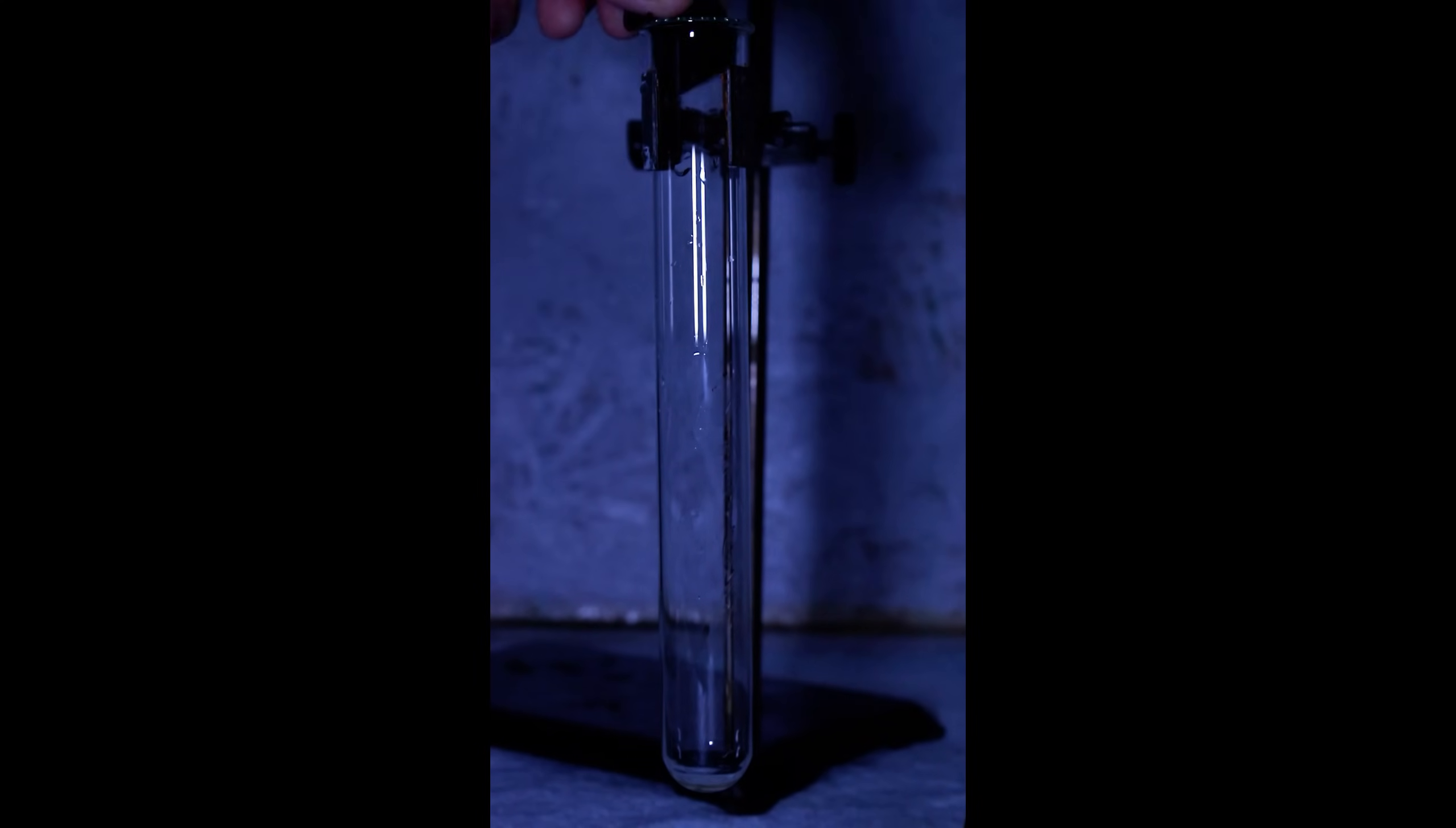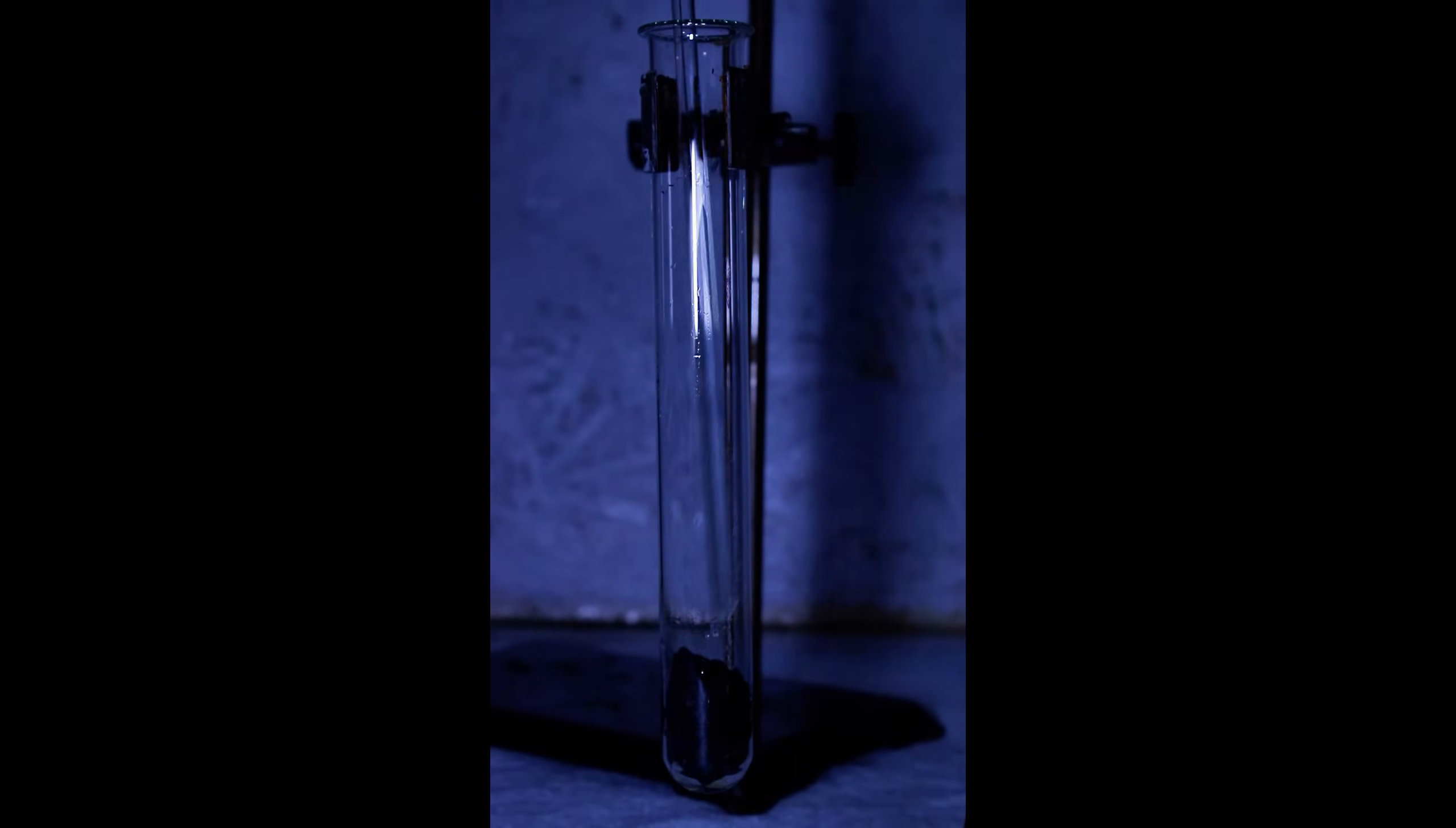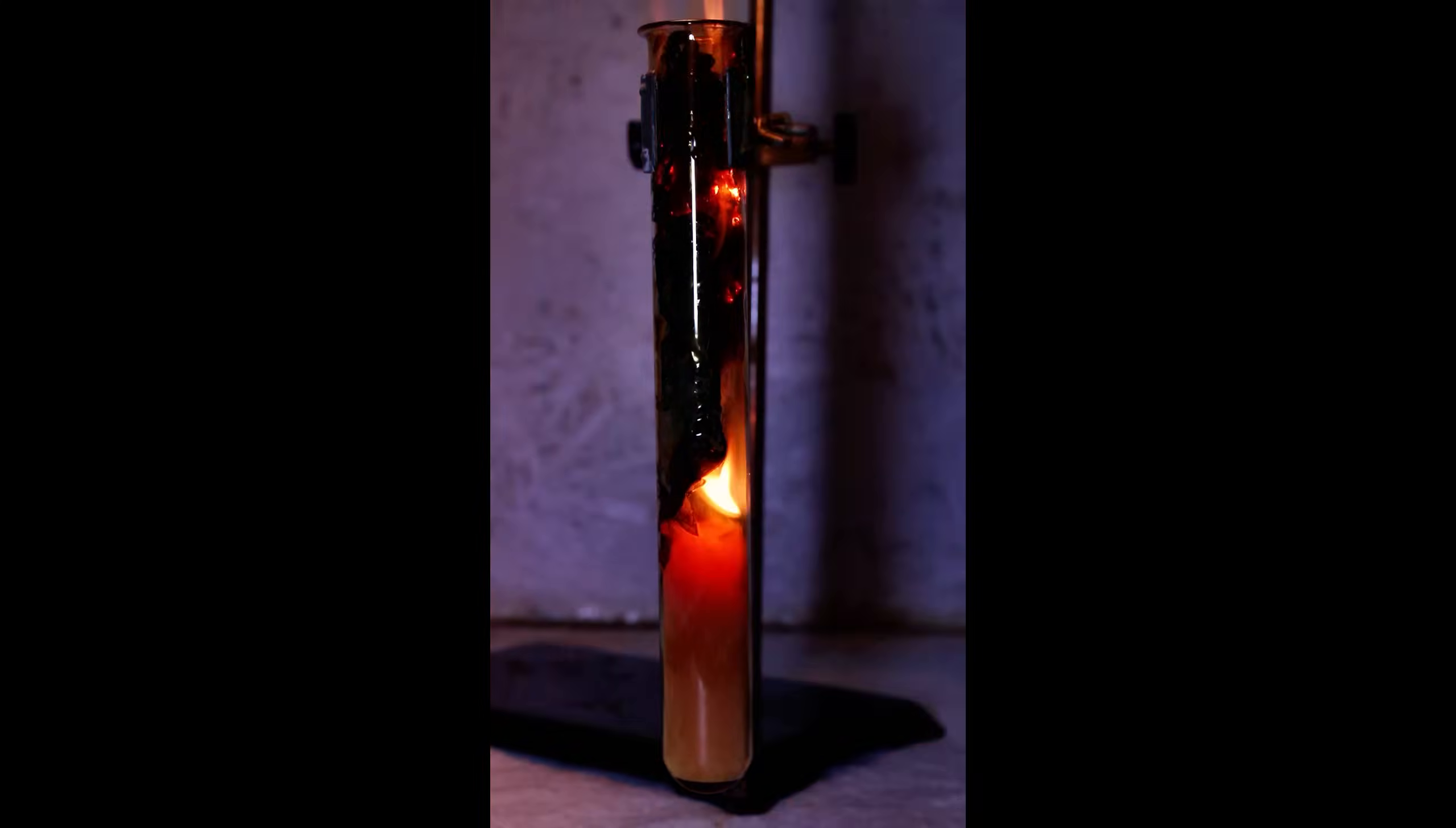As I mentioned earlier, pure nitric acid will violently react with nitrile gloves, which I decided to demonstrate here since you guys seem to like fire. As you can see here when I do the reaction in a test tube, fuming nitric acid can act as a propellant, and in fact many early rockets used fuming nitric acid despite its extreme corrosivity.